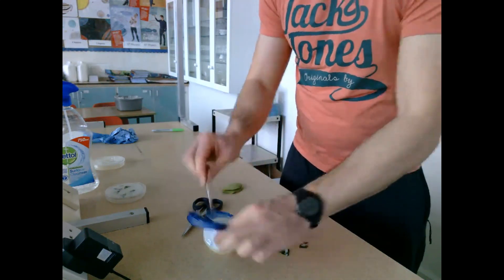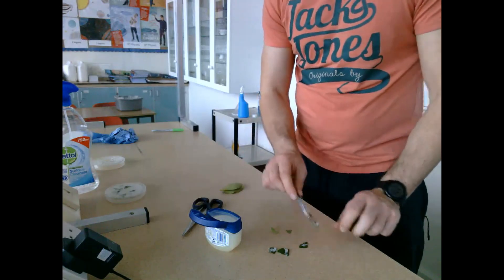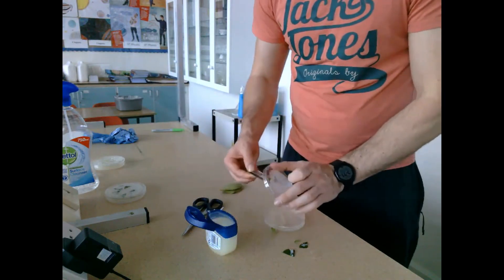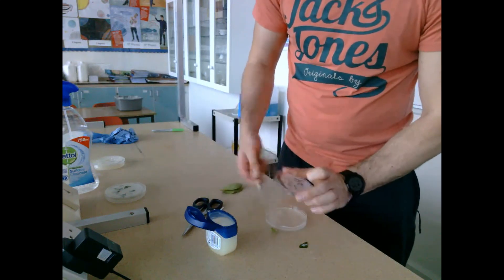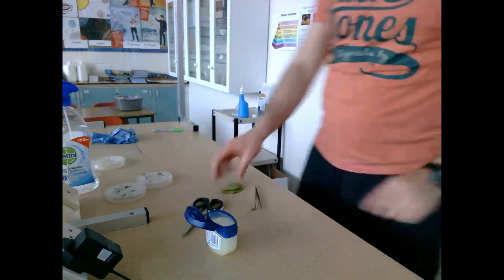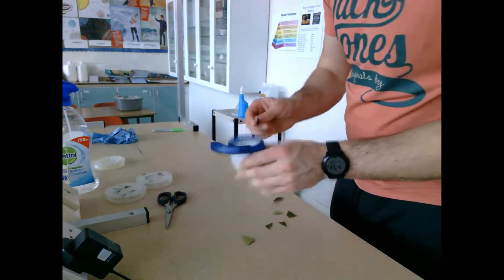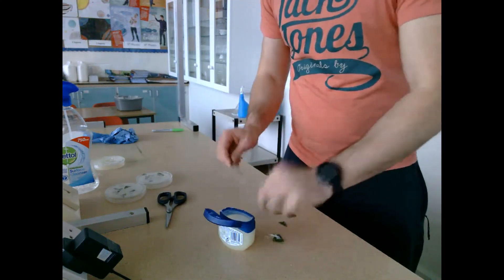There's also a fourth plate, and this is going to be our control plate. It is not going to be opened in the slightest, because we want no contamination — we don't want anything growing in our control plate. We're going to use it for comparison to prove that any growth in the experimental plates came from the leaves rather than from any other source.